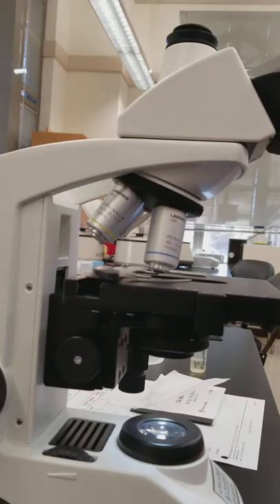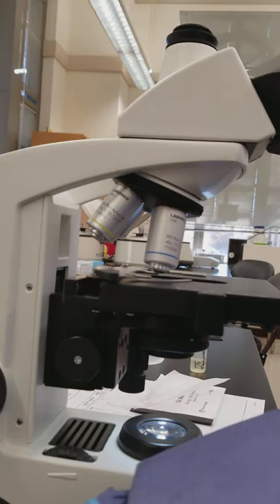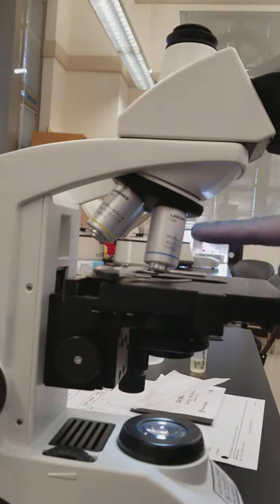Okay, hi everyone. Today I'm going to show you how to clean your microscope. I just looked at a hematology slide under oil, and if you'll notice I have the 40 moved away.